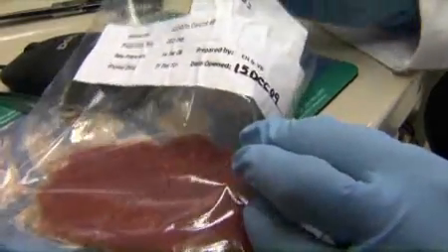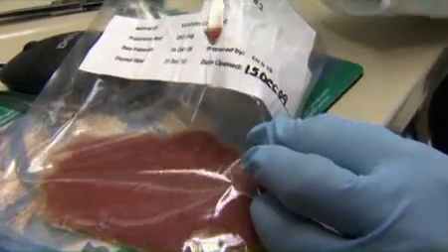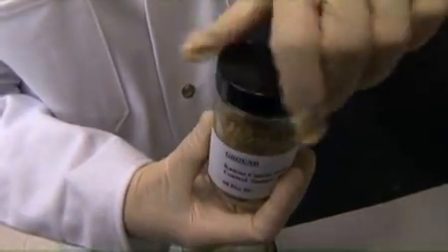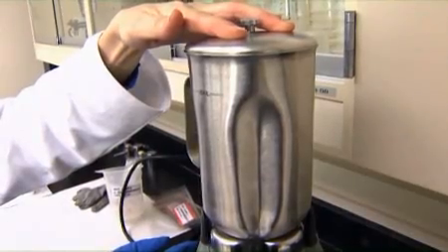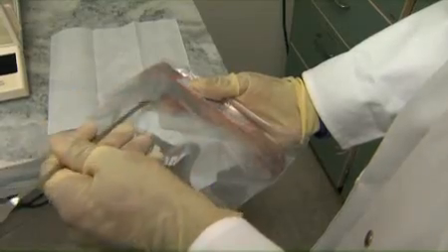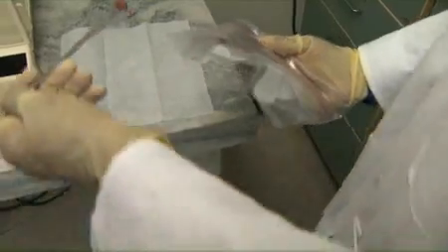We urge you to determine what specific GLP and safety requirements are necessary for your own applications. Some of the recommended guidelines for good laboratory practices include: take measures to maintain the integrity of the samples throughout the process by limiting exposure to air and non-suitable storage temperatures. The process of blending or grinding creates heat which can degrade samples, so chopping and grinding times should remain in the 30 to 60 second range. Wear gloves when handling samples and items associated with the test to prevent cross-contamination. Oil, moisture, or any other material on bare hands can affect the sample integrity, thus resulting in inaccurate data.